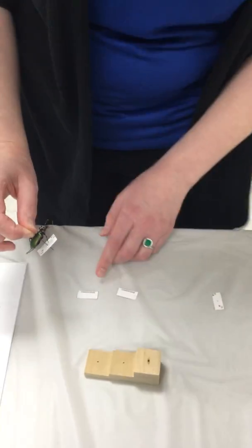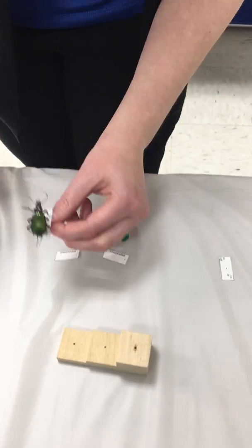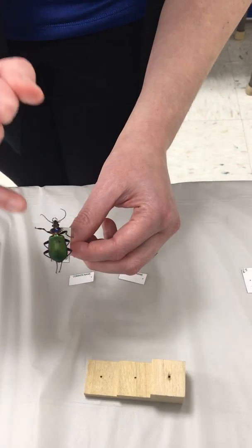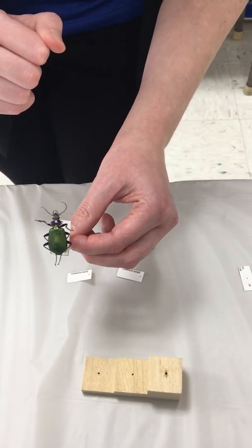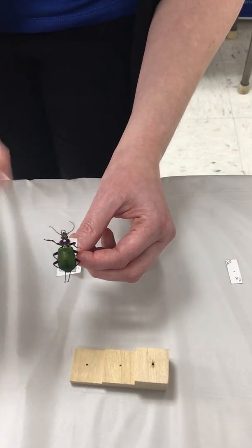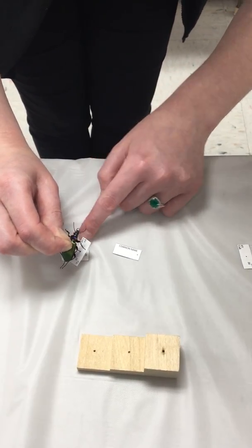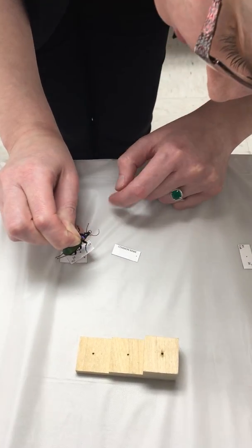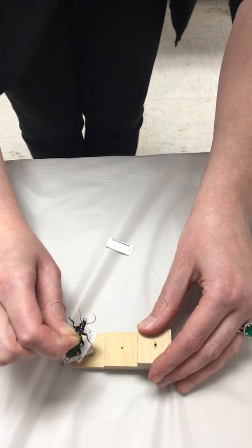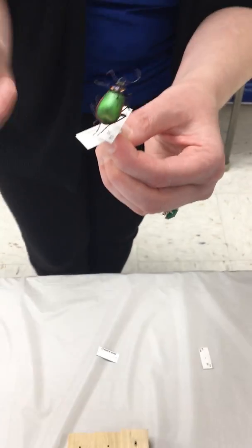We are now ready for our common name. If I was filling out this label for this specimen, this would be our caterpillar hunter. It's a type of ground beetle. As a throwback to the previous video, you can see that I've pinned it on its elytra on the right side. This is one of those insects we don't pin down the middle. All right, I'm going to poke that little black dot as best as I can on the common name, and the common name label is the bottom step of our pinning block. So once you get it to the right height, now we can adjust it.